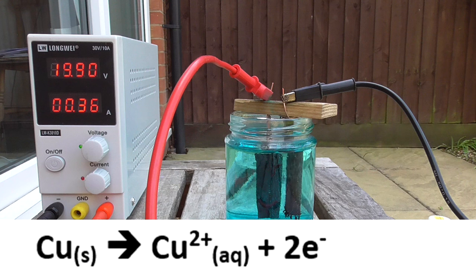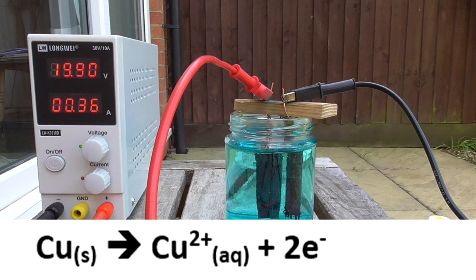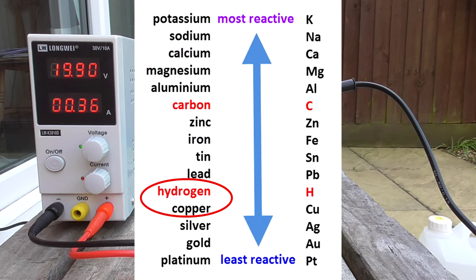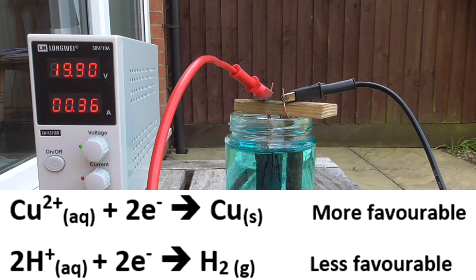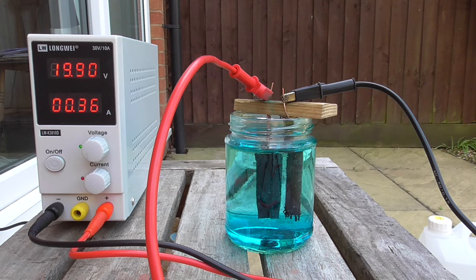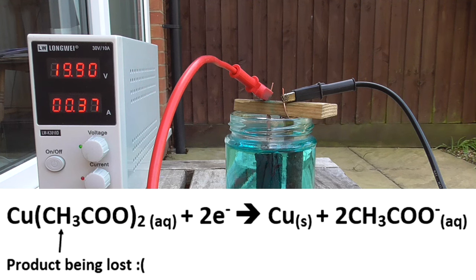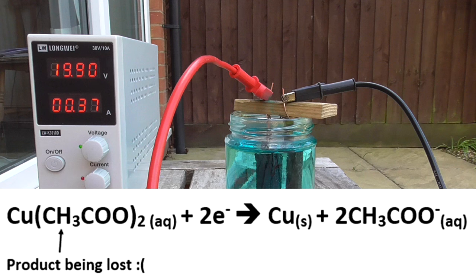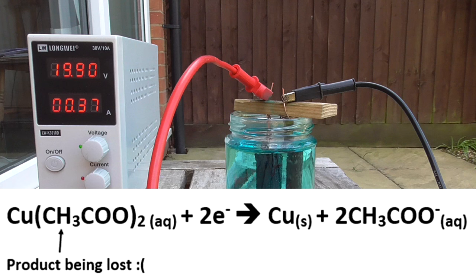When the hydrogen ions reach the negatively charged cathode, they gain an electron and become reduced into hydrogen gas. At the copper anode, the copper atoms lose two electrons and become copper 2+ ions. These ions flow freely through the solution, giving us copper acetate. However, because copper is lower in the reactivity series than hydrogen, it is more favorable for the copper ions to be reduced than for hydrogen ions to be reduced. In fact, industrially this is how we purify copper metal, except we use copper sulfate instead of copper acetate. So there comes a turning point where the copper ions are in sufficient concentration to be reduced instead of the hydrogen ions, which means all the copper ions I'm getting as copper acetate are being reduced back into copper metal, decreasing my yield.